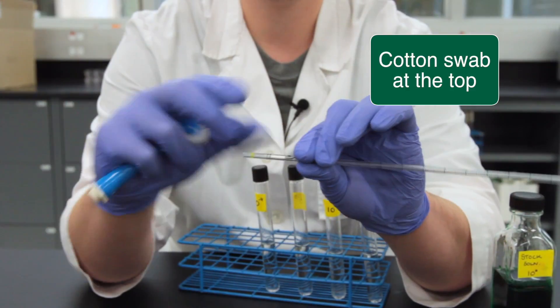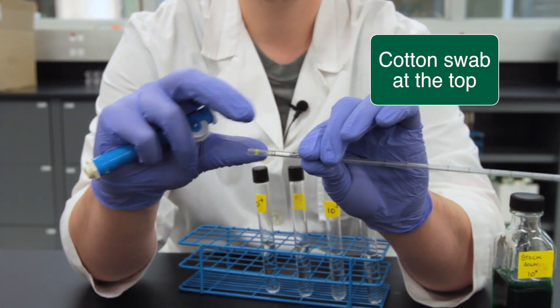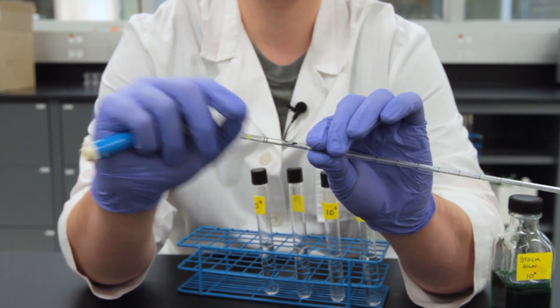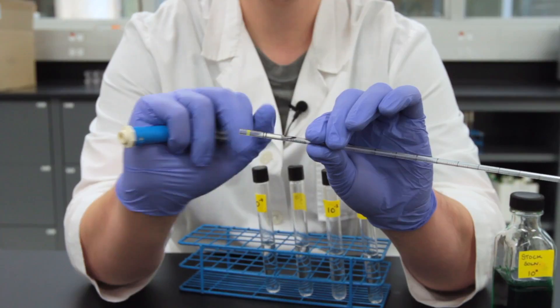Also notice that there's a cotton swab in here. That cotton swab is designed to prevent you from drawing up too much liquid into the plunger itself.